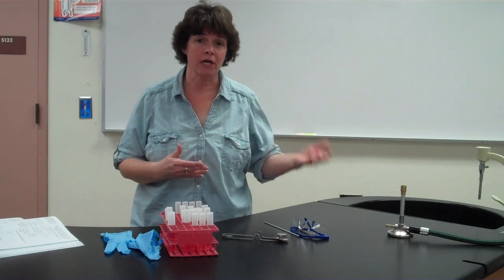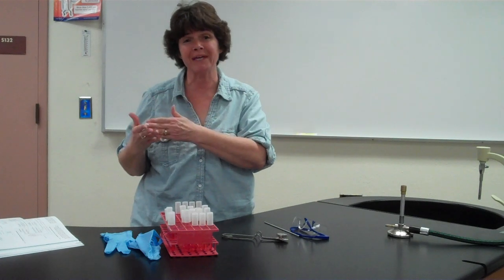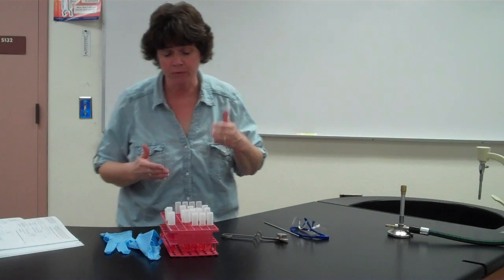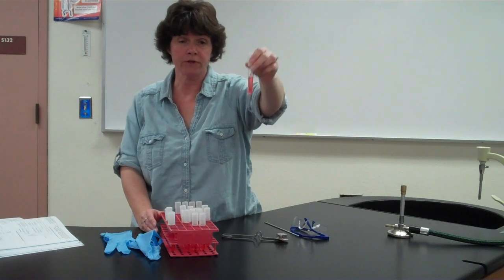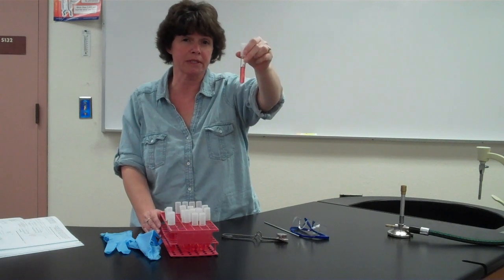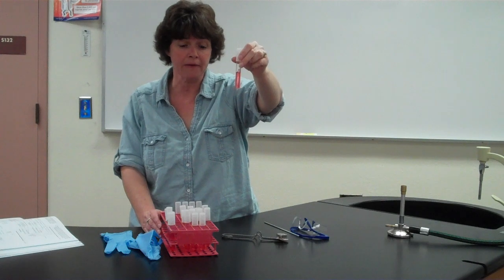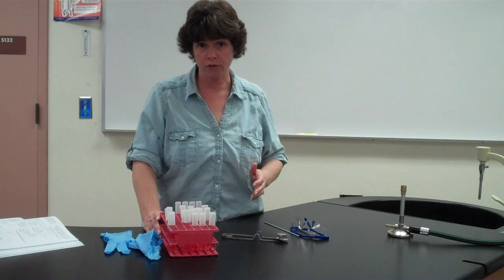With the fermentation tests, it's really easy to detect fermentation because we can use an indicator called phenol red. Phenol red will turn yellow in the presence of acid, and it will turn more of a pink color in the presence of a base. So in today's lab, when we look at the results, what you're going to be looking for is a color change. The original tubes are going to be a light red in color. If they're not red or very close to red to begin with, then there's possibly a contamination or a problem with the media. So make sure you note the color of the tube before you even start.